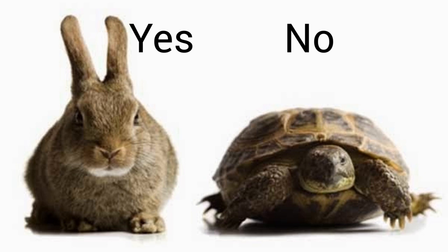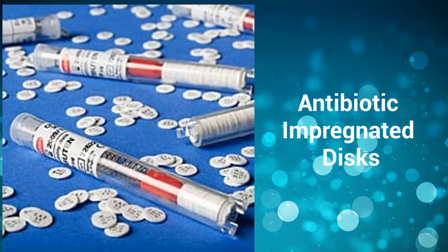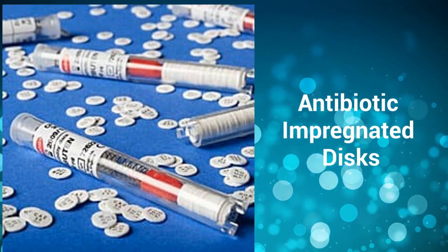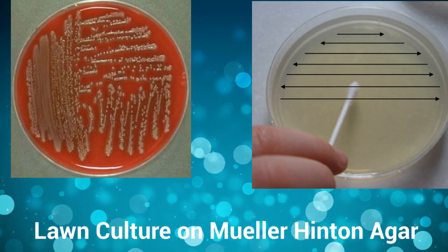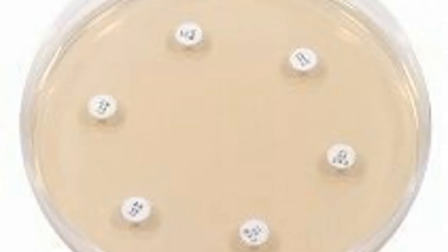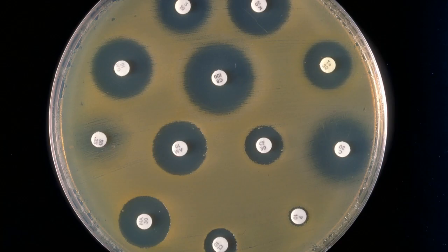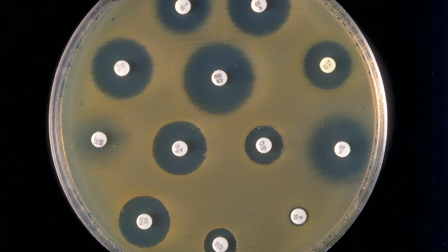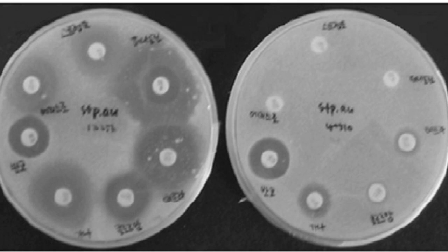It is suitable for rapidly growing bacteria and not for slow growing bacteria. In this method we use filter paper discs. These filter paper discs contain an appropriate concentration of the antibiotic solution. First, we inoculate the test bacterium as a lawn culture on the medium called Mueller-Hinton Agar. Then we place the filter paper discs on top of the medium. The antibiotic in the disc diffuses out into the solid culture medium. The concentration of antibiotic is highest near the disc and decreases further away from it.